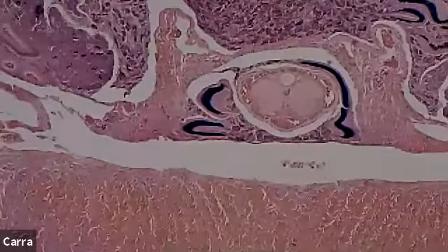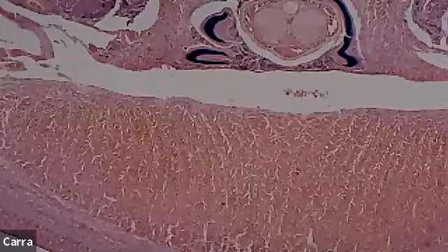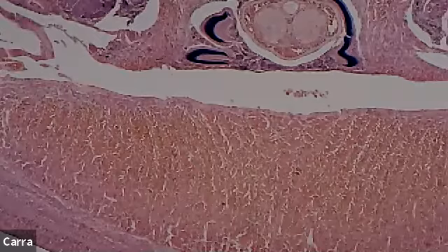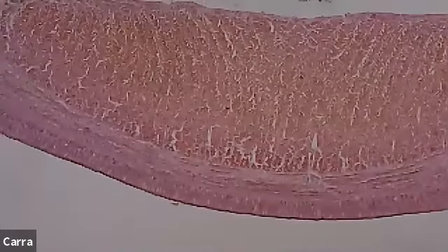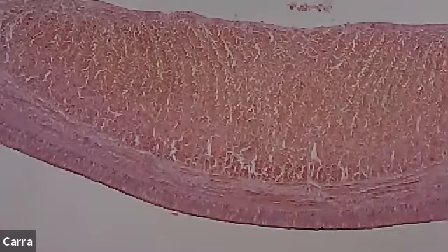Well, first of all, you can tell that this is really a lot more complex, right? Remember when we looked at the sponge and it just looked really cavernous and like popcorn fluff? Well, now we can see that there's a really high amount of both tissue and organ development. Just right down here at the bottom, what we're looking at is a really thick layer of tissues. On the outer layer, we have our epidermis, our ectoderm. Underneath that layer, where you can see the fibers going in the lengthwise direction, those are our circular muscles.